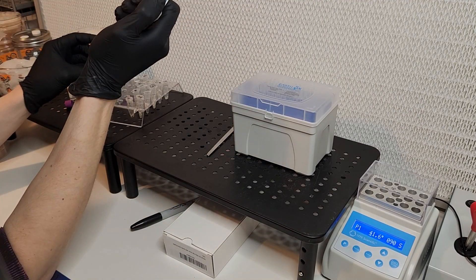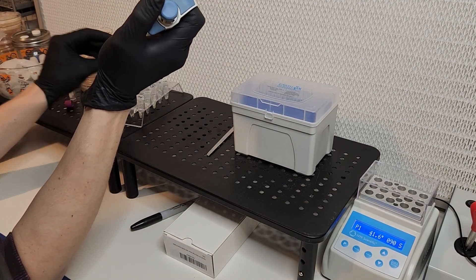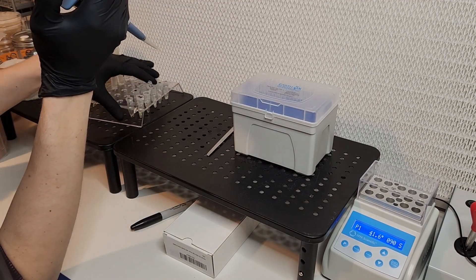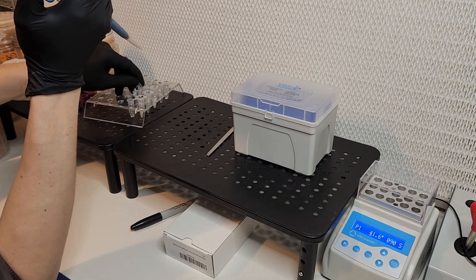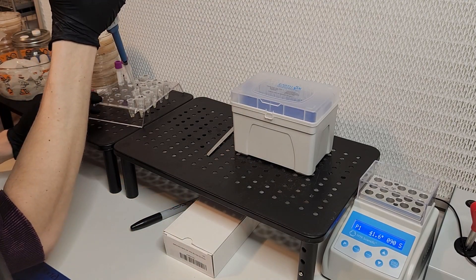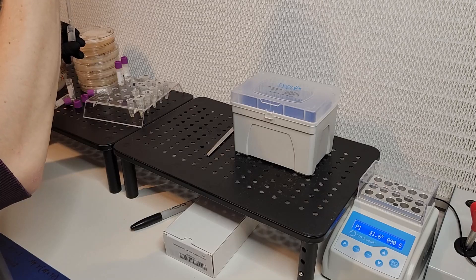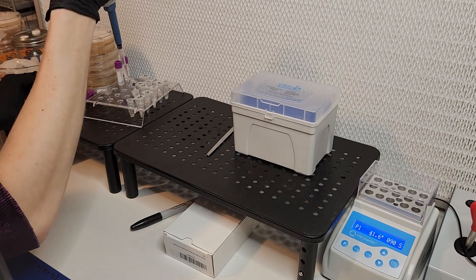Now here I'm adding all of my buffer solution into each tube. The kit comes with one milliliter of buffer solution and each tube requires half a milliliter of buffer solution. So I can do two reactions per buffer solution container.